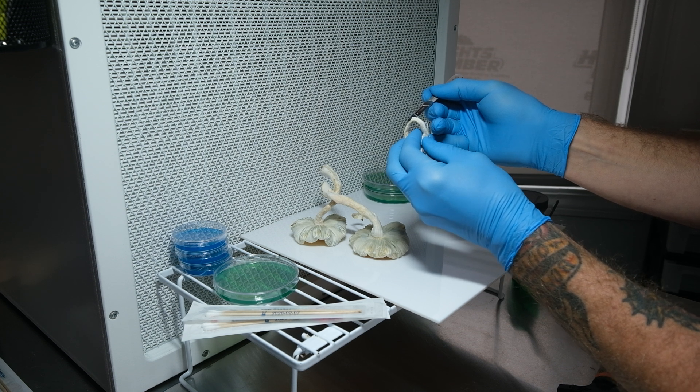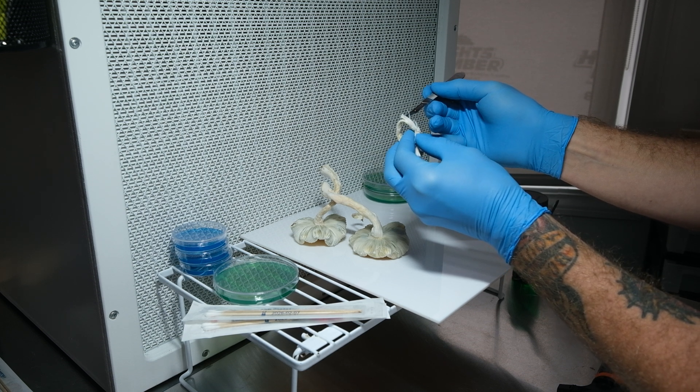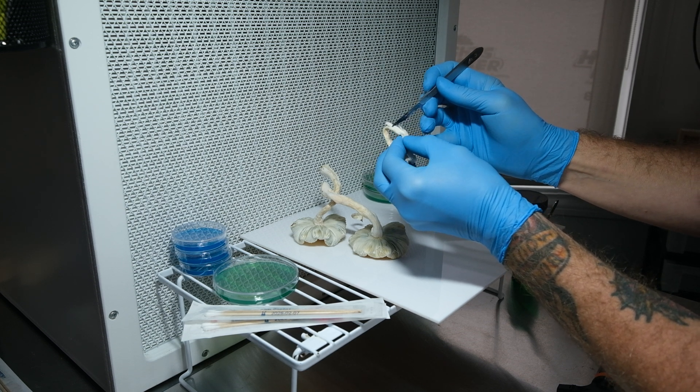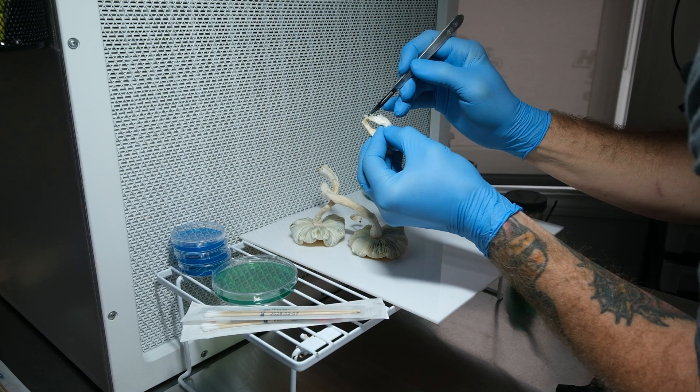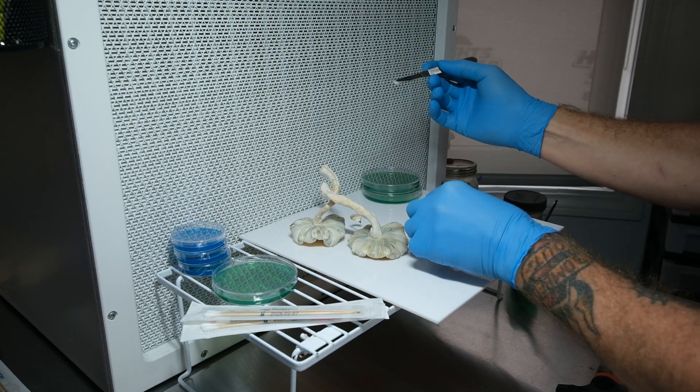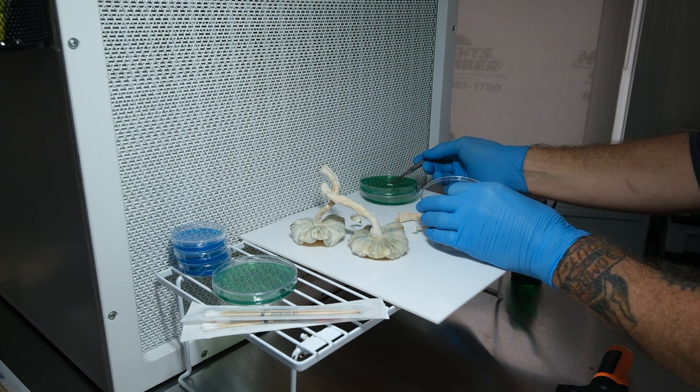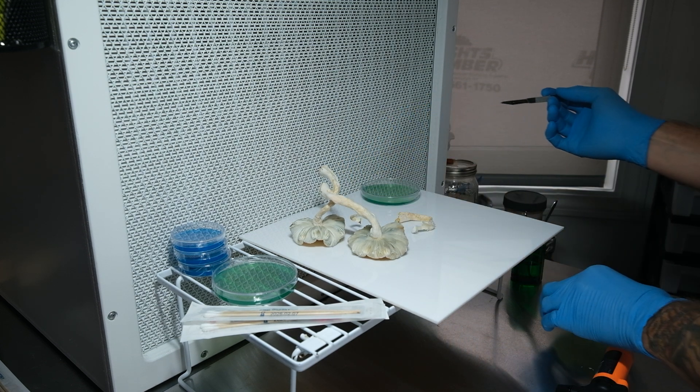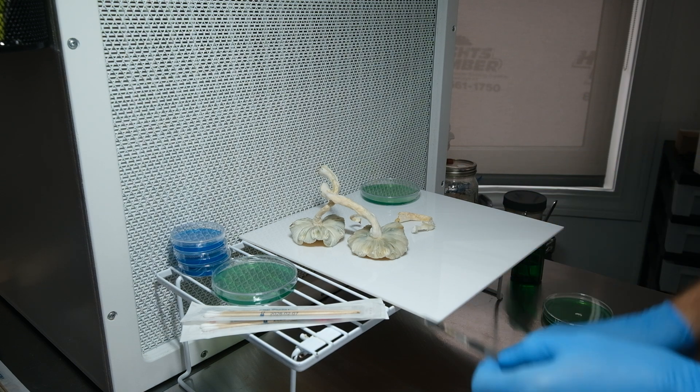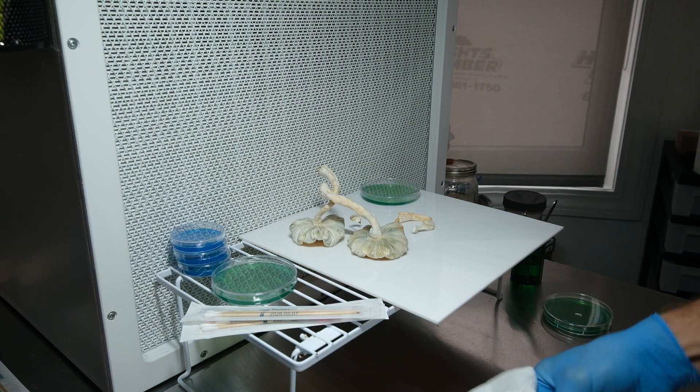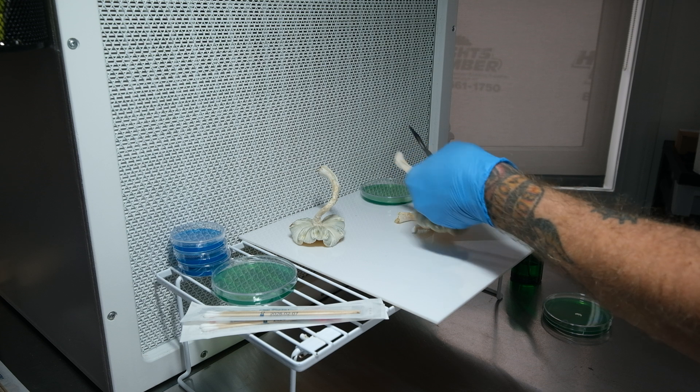Oh there we go. All right, we're just gonna quickly drop that on the plate. Don't put it away. Okay, tissue sample one. We're gonna go into the next mushroom.